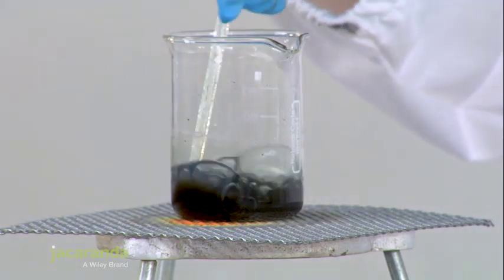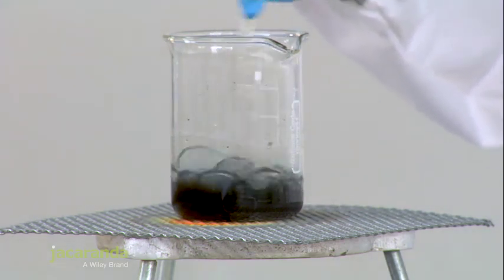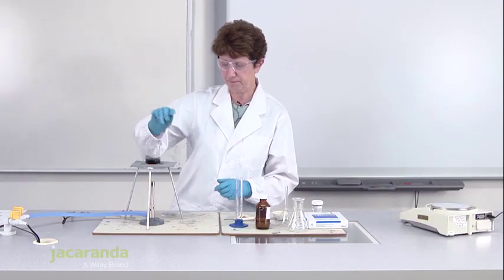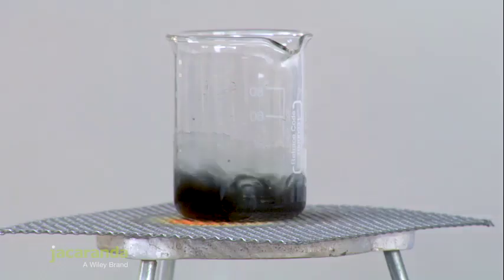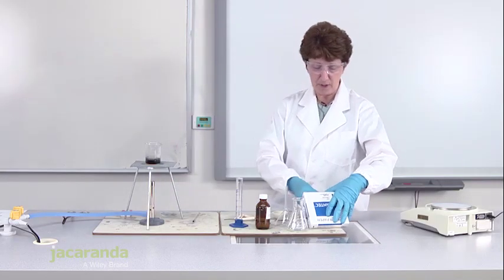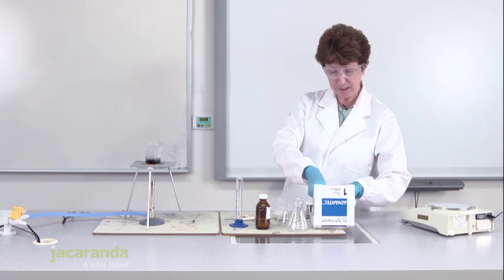You have to be careful with this because we use sulphuric acid. That's why we're taking some precautions because sulphuric acid is quite corrosive. Now it still looks black because we've still got excess copper oxide, so there's still copper oxide present. We're going to let that heat for a little bit. But while we're doing that, I'm going to prepare the filtration apparatus.